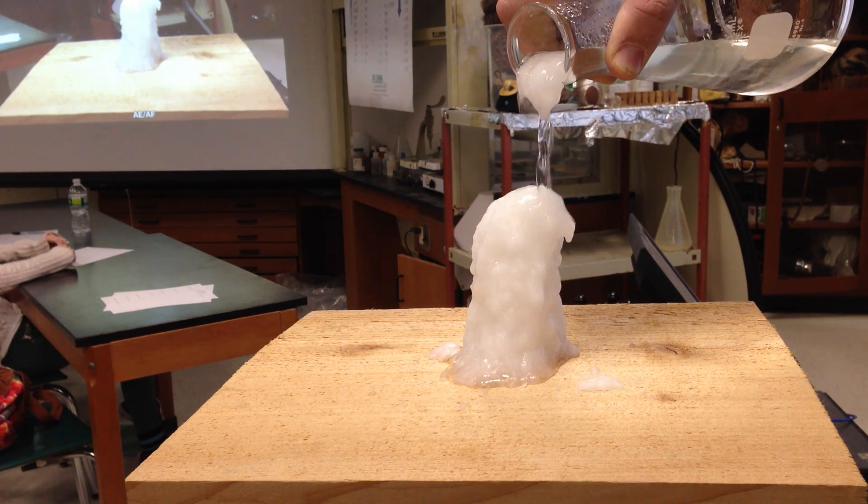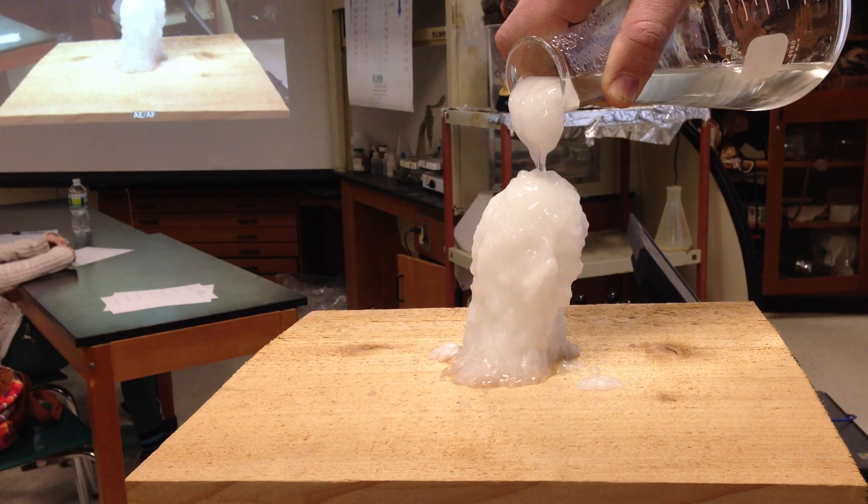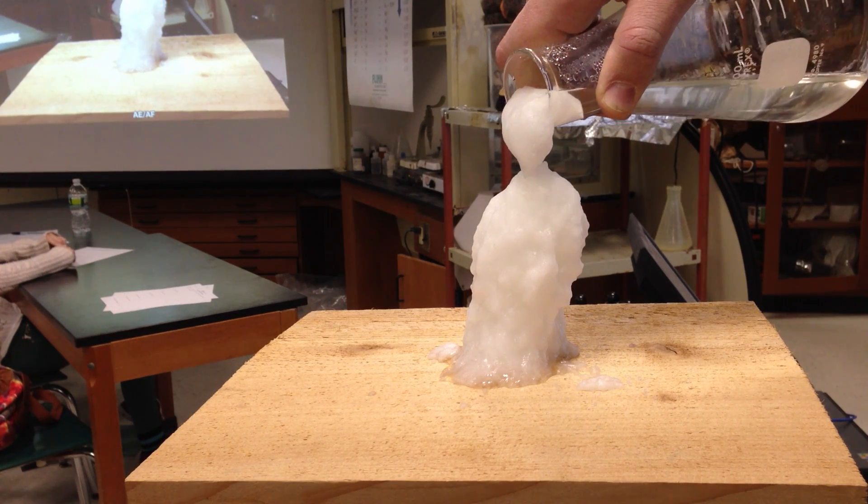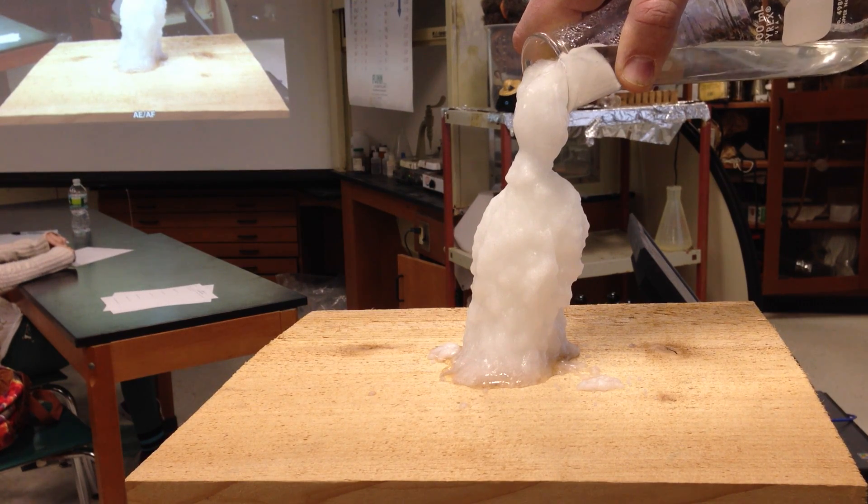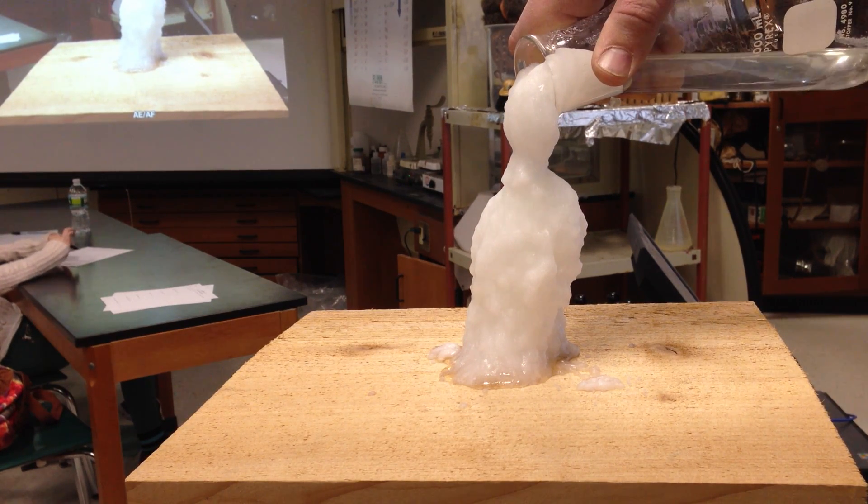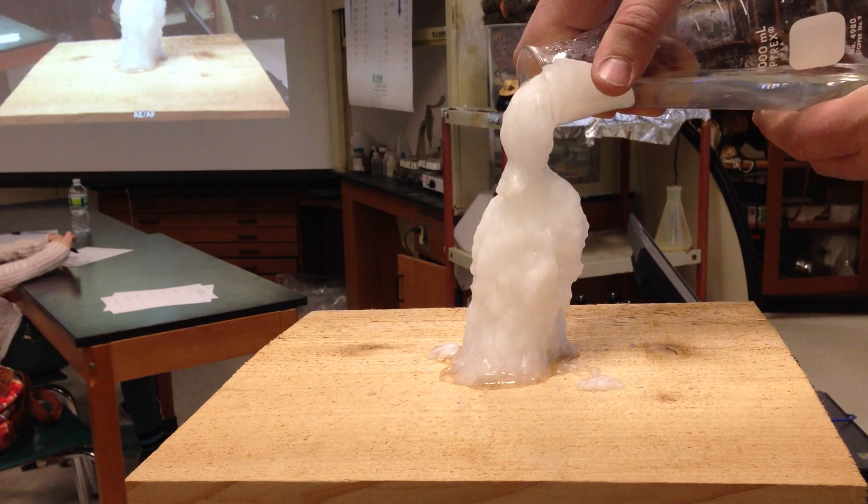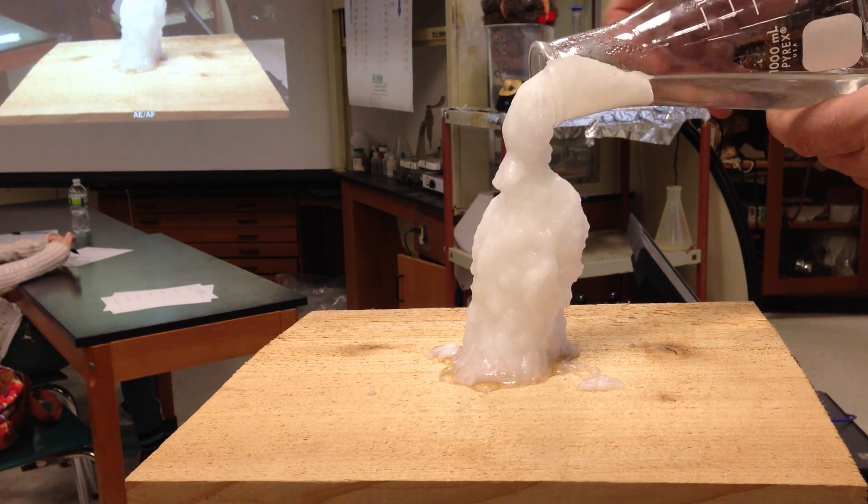Make a tree. Oh, now it's going back into the beaker. It's coming back into the beaker. Just quickly dump it all out.